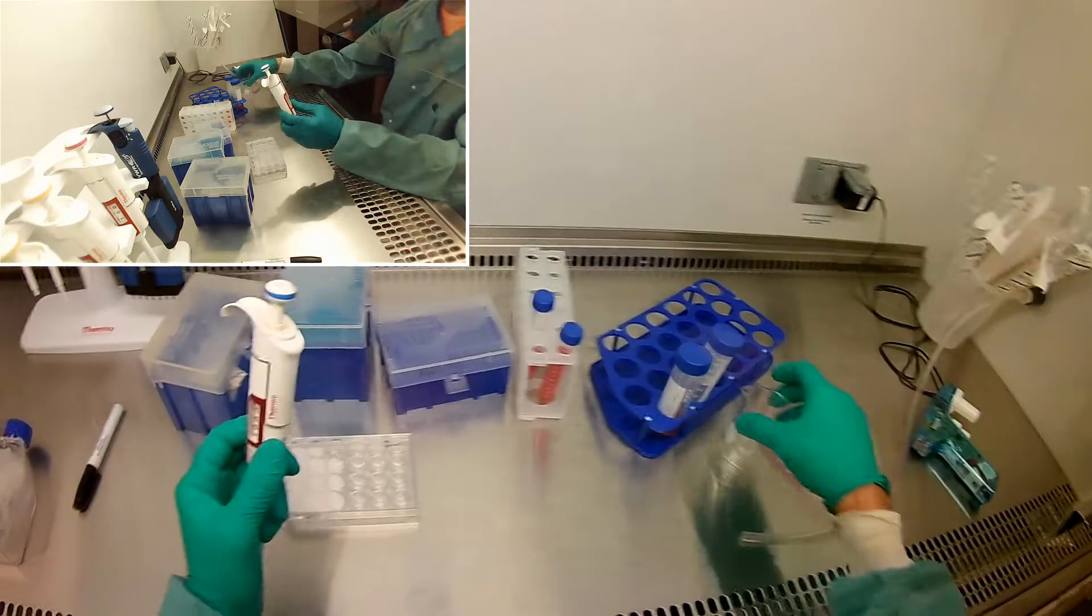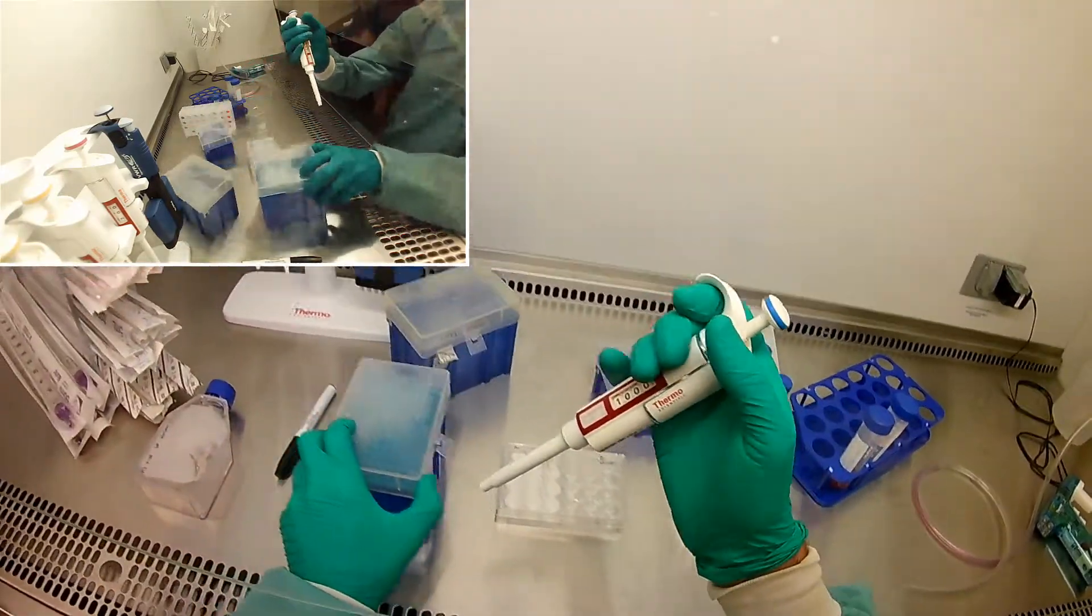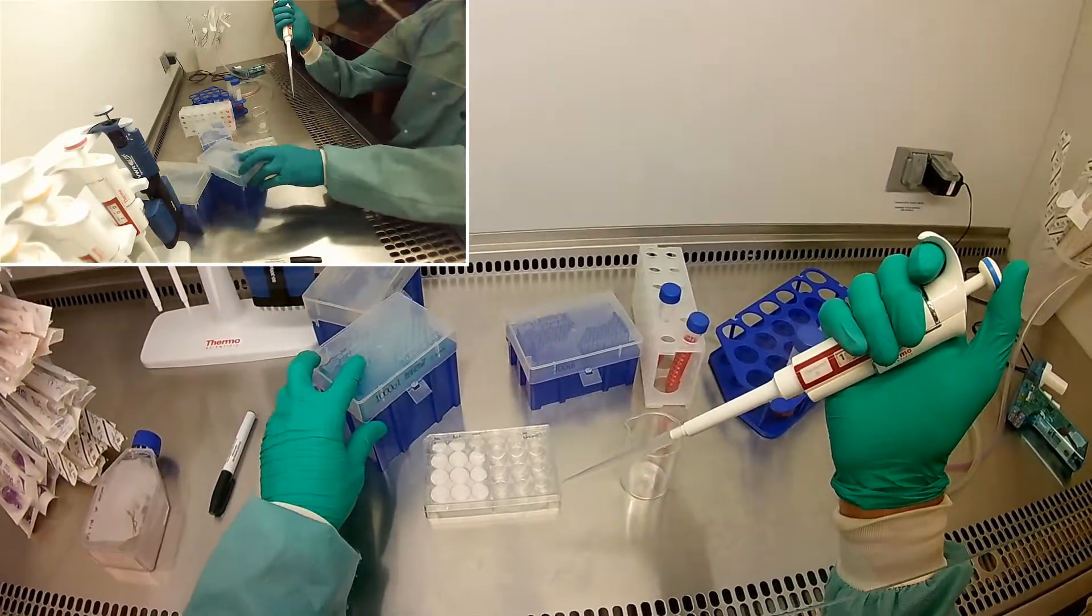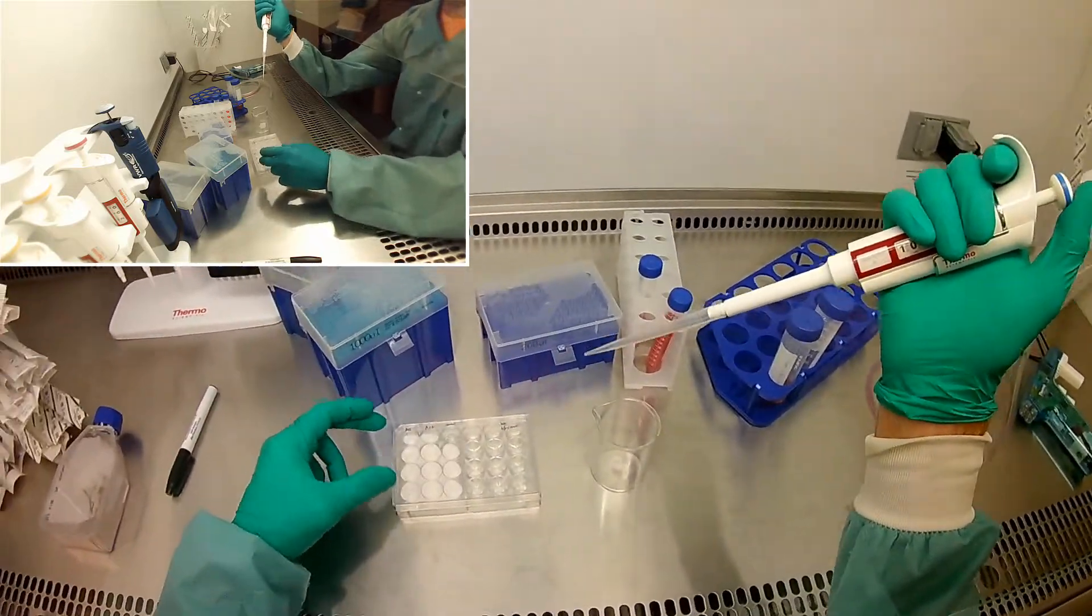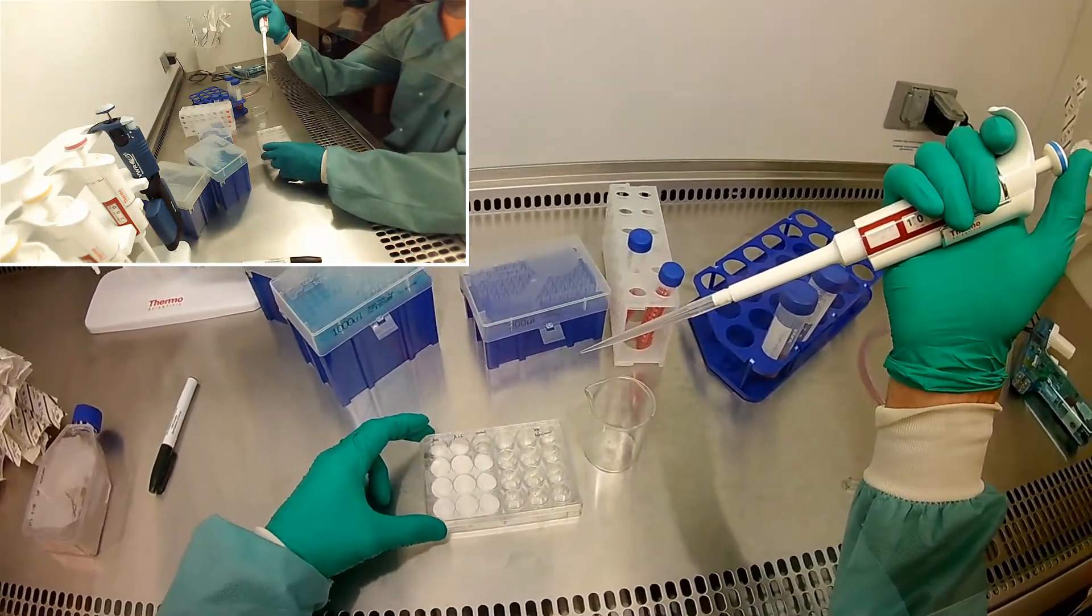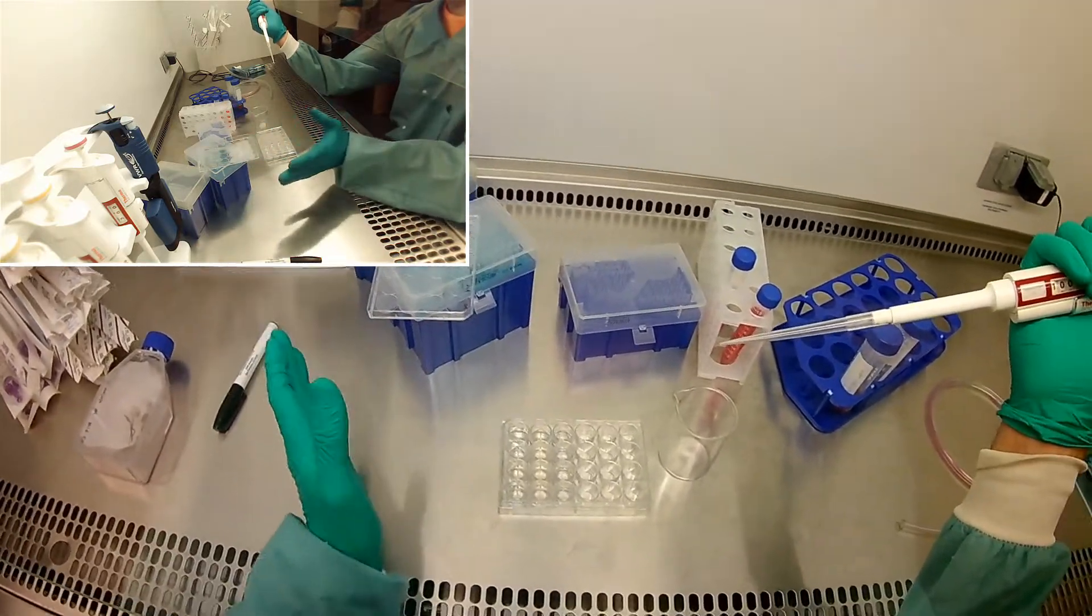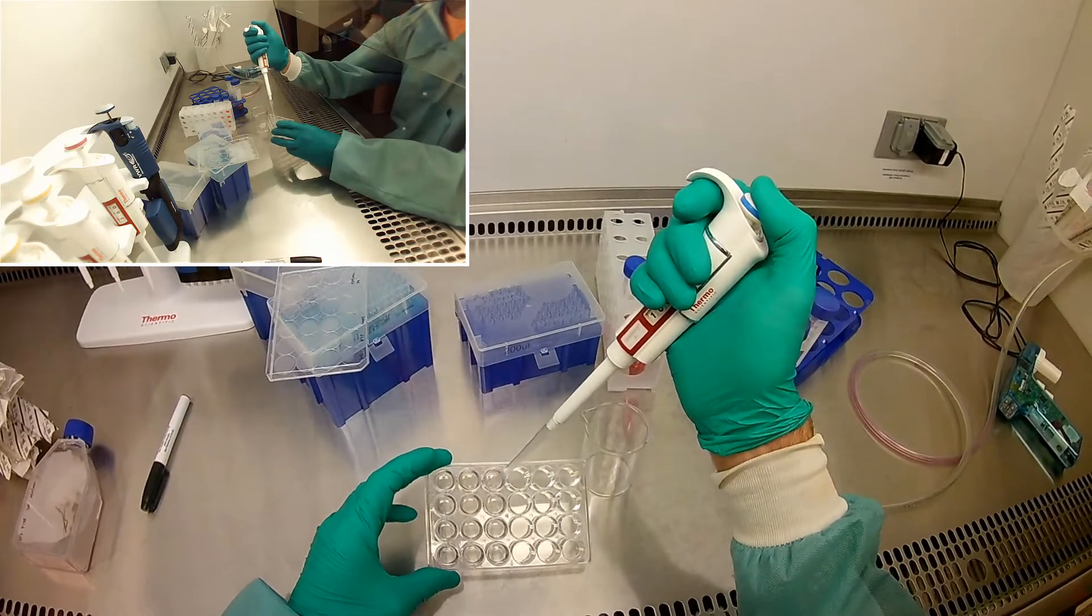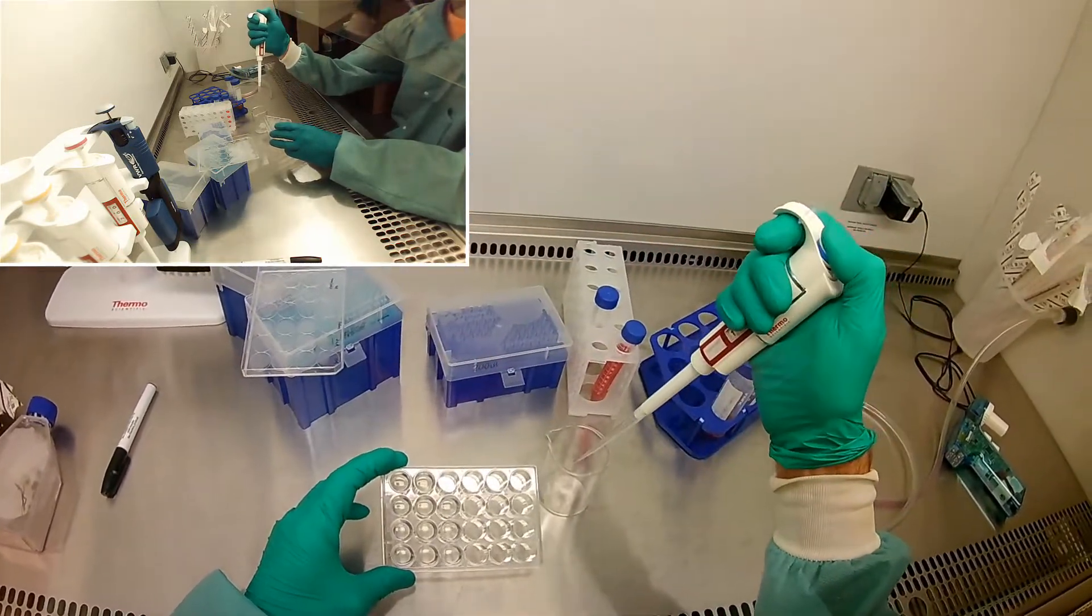And as I said, we're going to use this to aspirate the liquid because the gels are going to want to be sucked up, which will be a pain. And so this is actually a very difficult procedure to do. And so I'll just kind of show you, and if you were doing it yourself, you would see how much of a pain it is. So again, I do want to try to be sterile as possible. It's not the end of the day if I'm not. So I'm going to suck up all the control wells first because they're so easy.